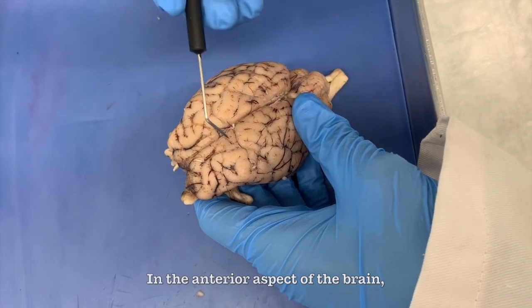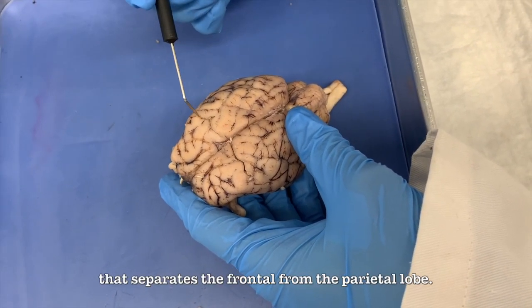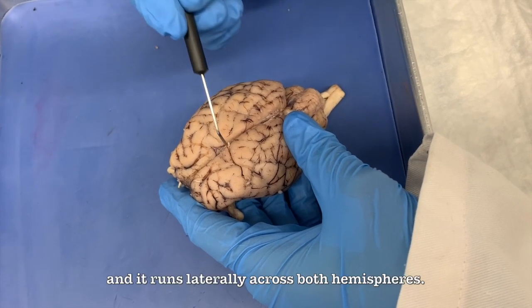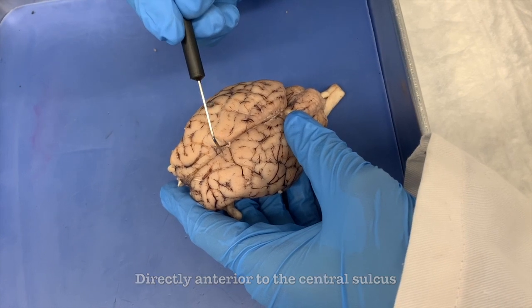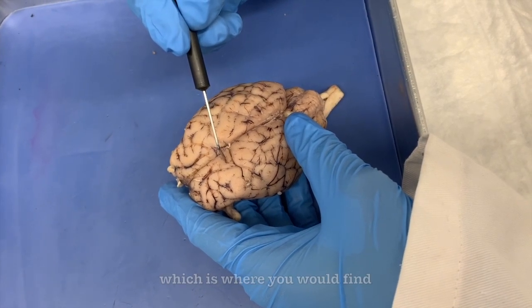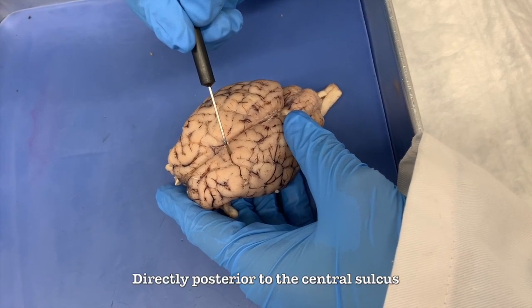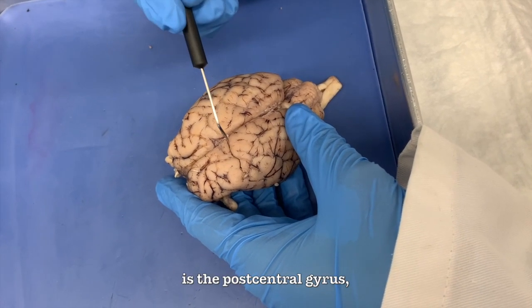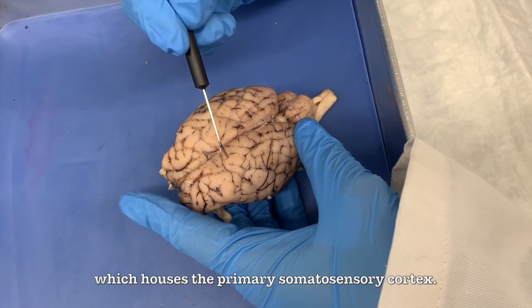In the anterior aspect of the brain, we have the central sulcus that separates the frontal from the parietal lobe, and it runs laterally across both hemispheres. Directly anterior to the central sulcus is the precentral gyrus, which is where you would find the primary motor cortex. Directly posterior to the central sulcus is the postcentral gyrus, which houses the primary somatosensory cortex.